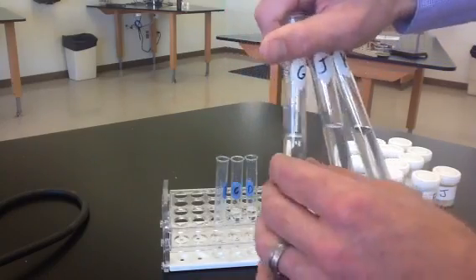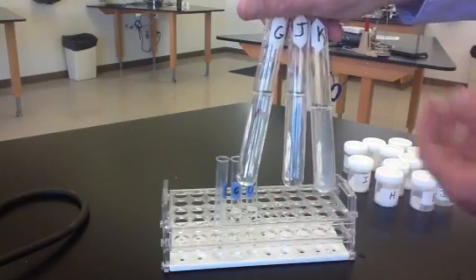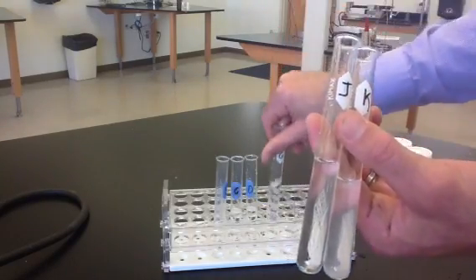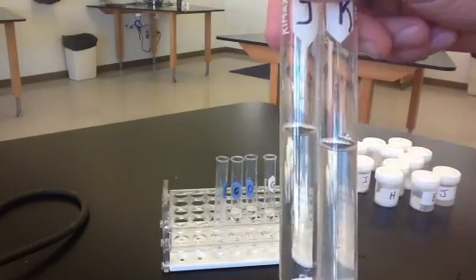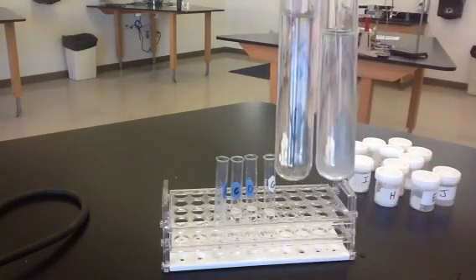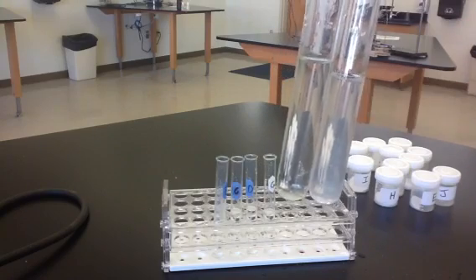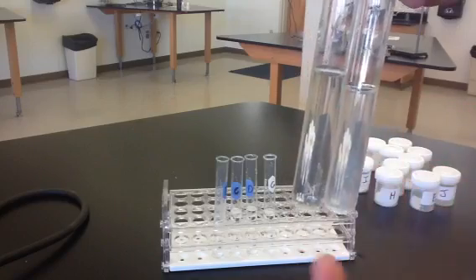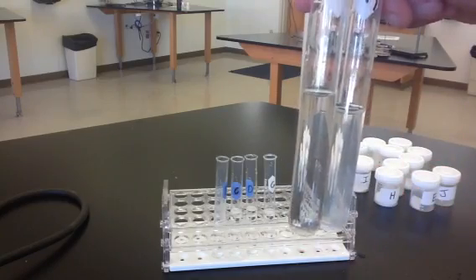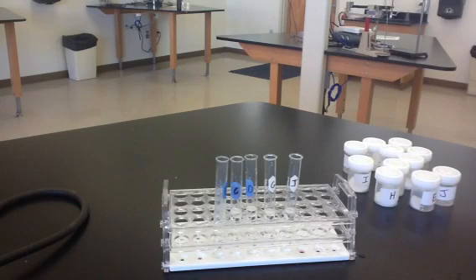And then if we look at G, J, and K, we'll see that there is a precipitate formed in solution K. So it's a little bit hard to see. We'll try to hold it up a little closer here. And you can see that solution K has become kind of cloudy. You can see some substance in there, and that is the precipitate that's formed. So K had a precipitate when mixed with sodium hydroxide, and that's why this solution is cloudy, while J and all the other solutions remained clear. So that test will help us to identify solution K.